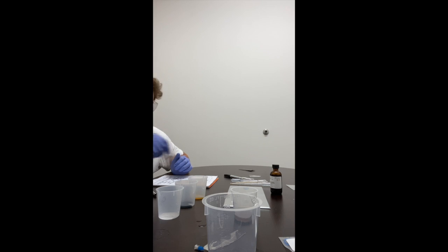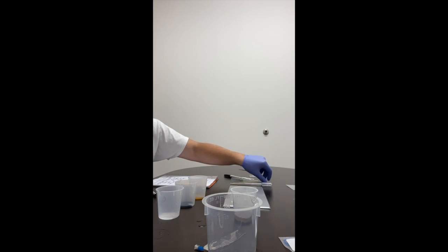Okay. Then we'll add 2 milliliters of IKI to the beaker water.